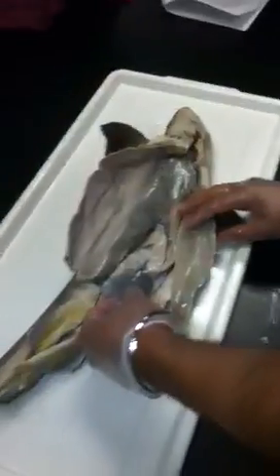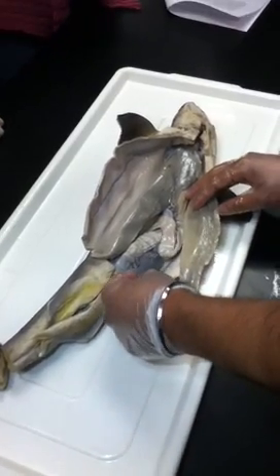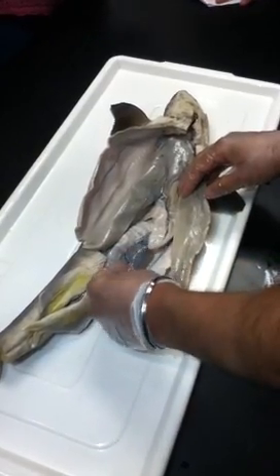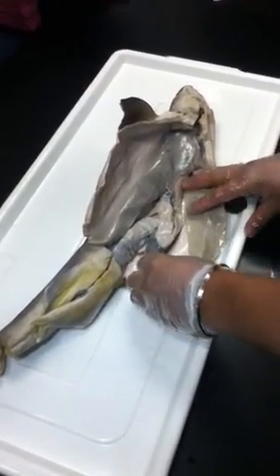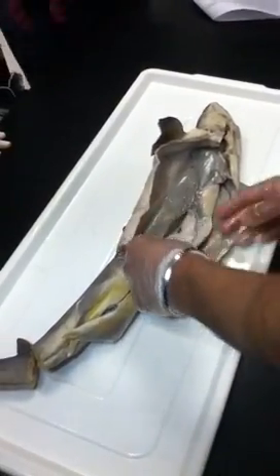I asked a question here in the last one. The spleen plays an important role in sharks that it does not play in other vertebrates. What might this role be? Keep in mind that sharks are cartilaginous fish and therefore have no bone. Production of red blood cells. Exactly. Interesting. Cartilaginous fish don't have bone. The spleen is producing the red blood cells. And then continue from the stomach to the intestine.